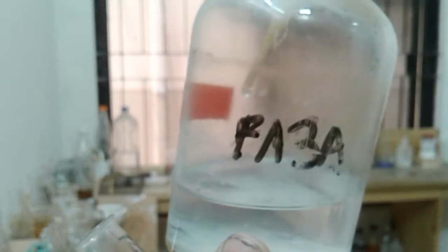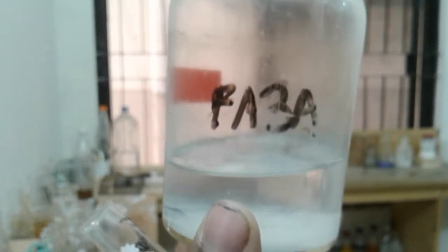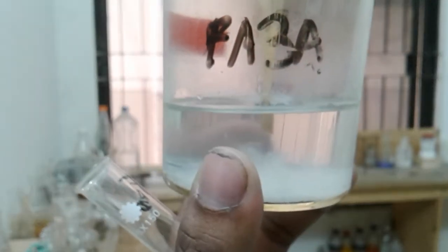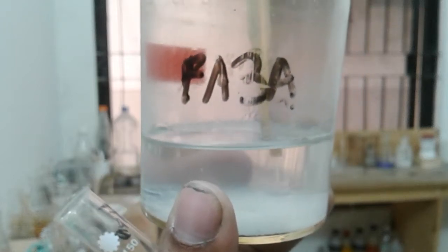So when you are doing a test with a reagent, if you see that there are precipitates at the bottom, do not disturb them. Put it half inserted, do not touch the precipitate. Oh, I have disturbed them, sorry, so I will be taking from here.